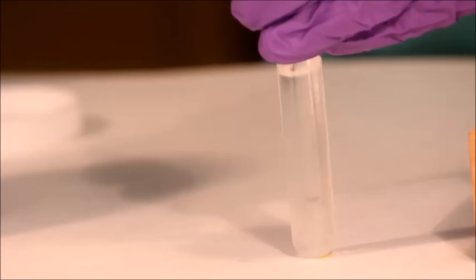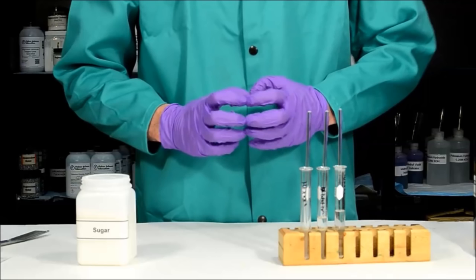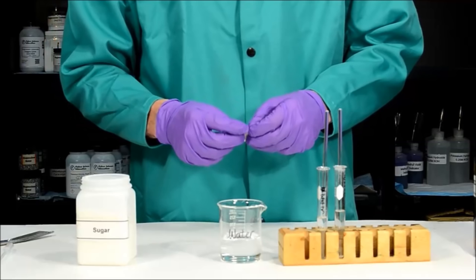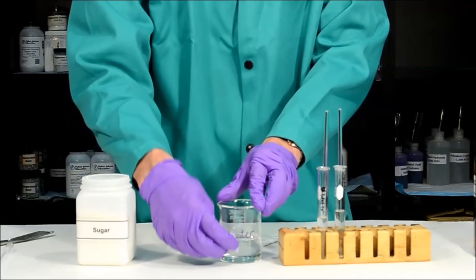The final thing we need to do is clean up. Make sure you dispose of the hexane into the appropriate waste container. After that, take care of all labels on any glassware used. Simply use an alcohol swab — the ink of a Sharpie is soluble in alcohol, so it will easily wipe off. Remove all labels and dispose of the alcohol swab in the garbage can.